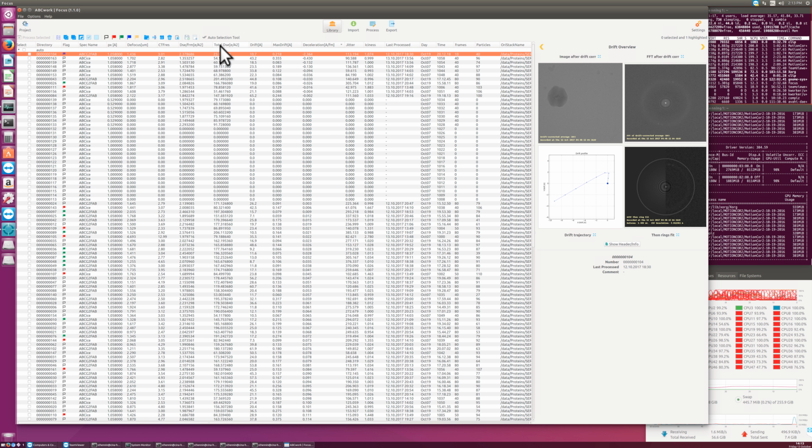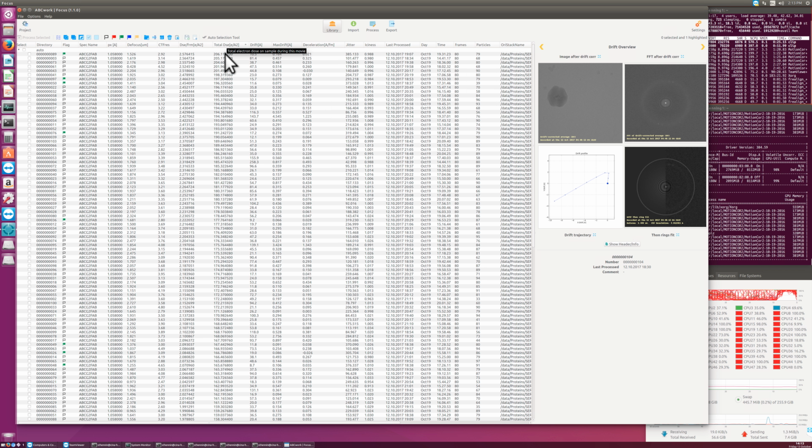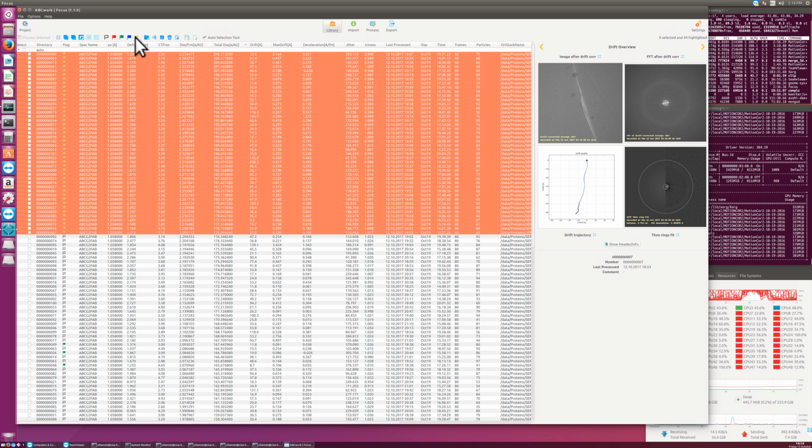The total dose should typically be what you like, and if this is too low or too high, then you could delete it. So you could just sort this table and say everything that has a dose that is really ridiculously high because something didn't work out, you could just go for all these and put them to some color or so, or move them into the trash immediately.